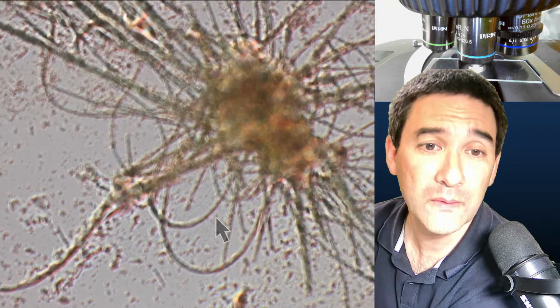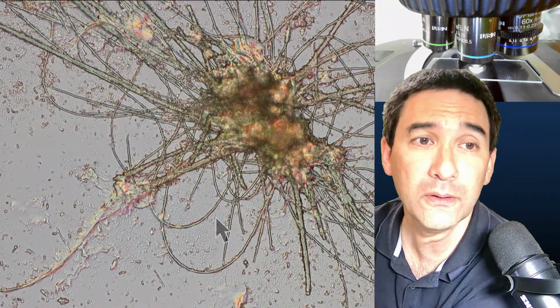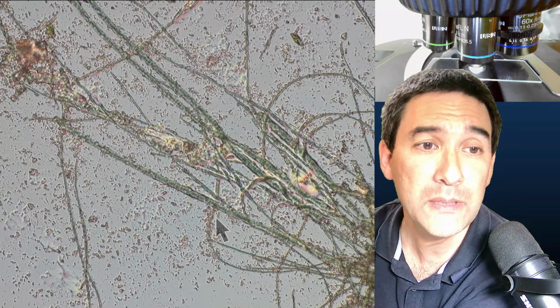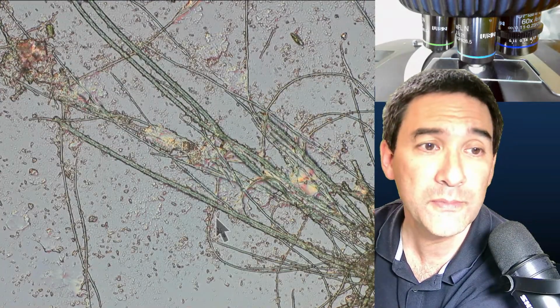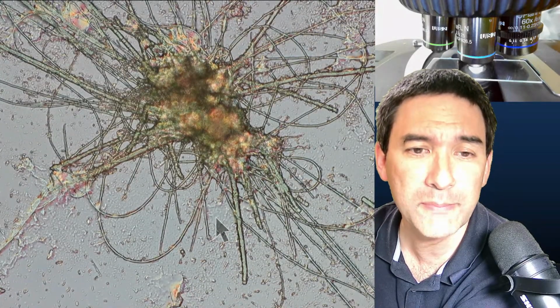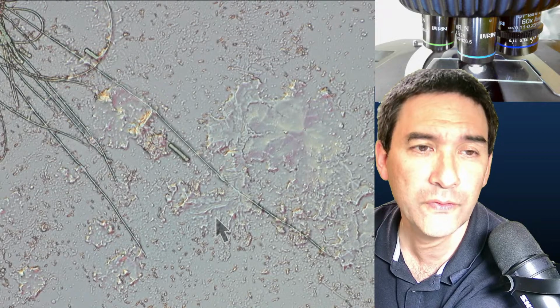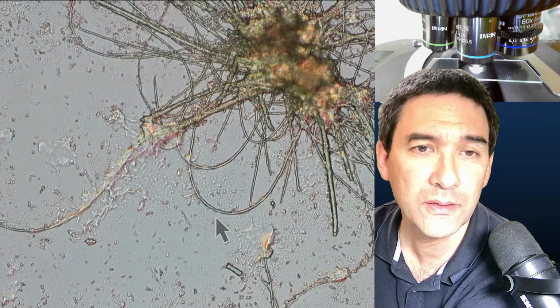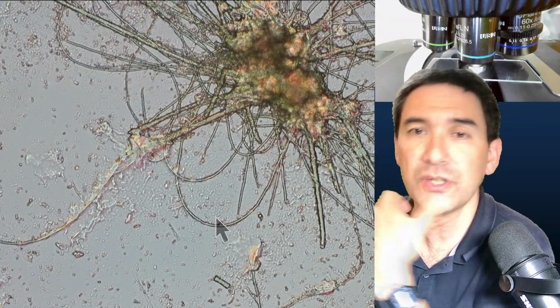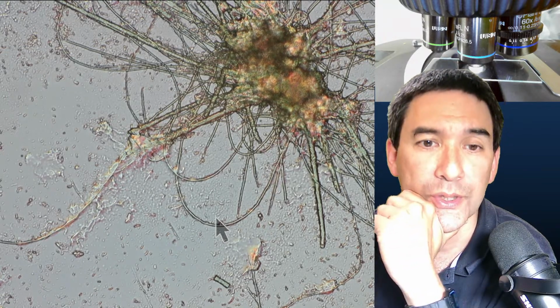And I would like to see now how the appearance differs when I add some mounting medium over it. Because sometimes folks want to know, okay, why is the mounting medium so important? I said, well, it's not only for preserving and protecting the specimen, but also for actually improving the image quality. And the question now is which mounting medium do I use? I mean, there are so many different ones here.